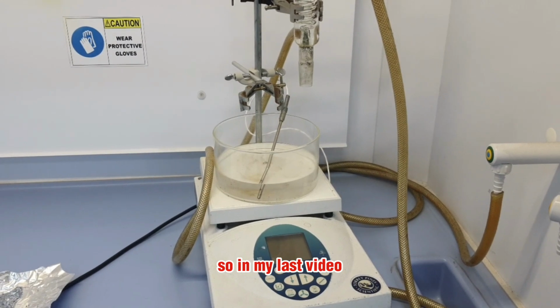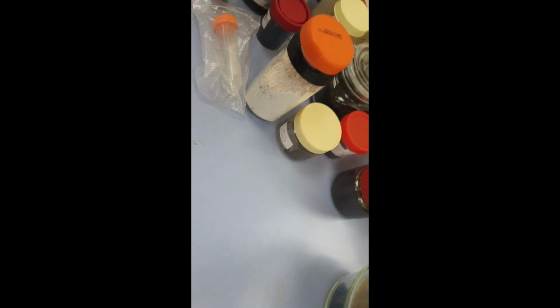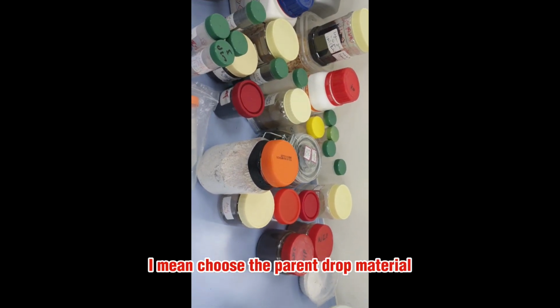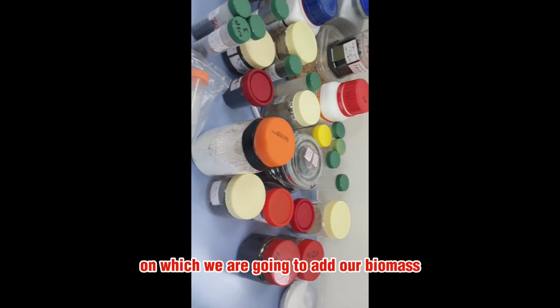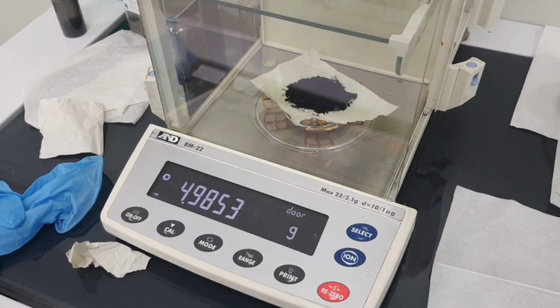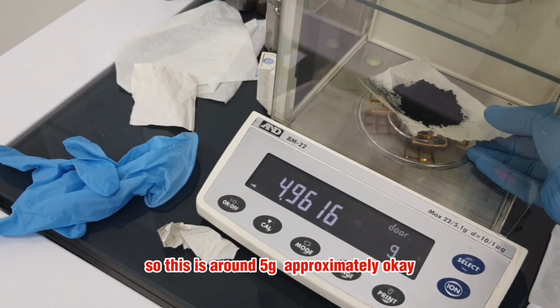In my last video, you saw that I prepared layered double hydroxide, or LDH, using the hydrothermal technique. So the first basic step is to choose the parent raw material, or parent LDH, on which we are going to add our biomass or whatever material we choose. In my case, I'm going to add around 5 gram approximately.